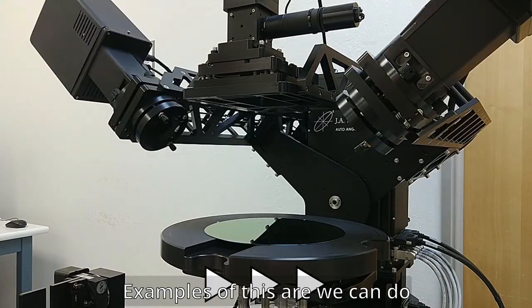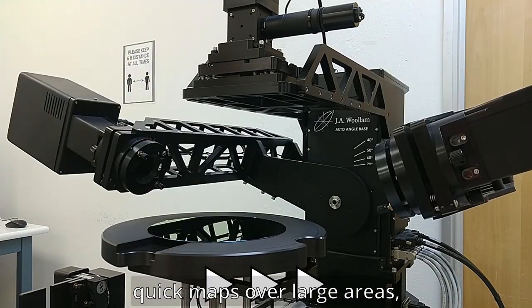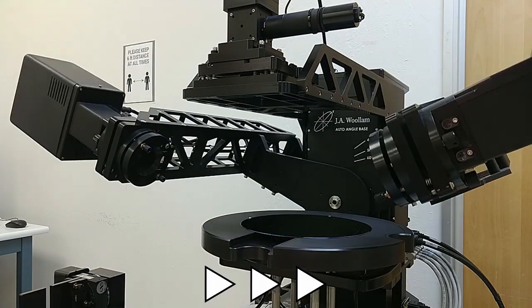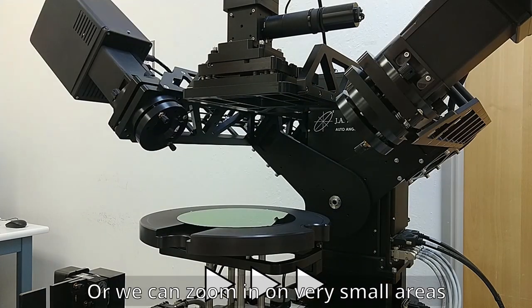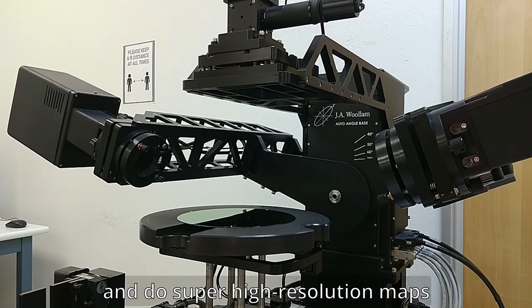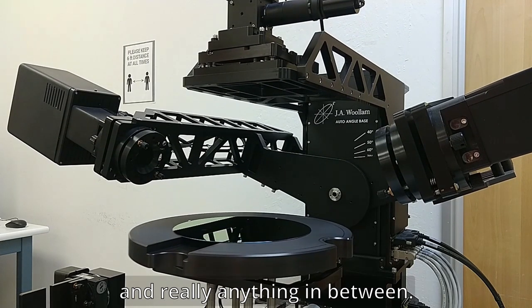For example, we can do quick maps over large areas just to try and get an idea of general uniformity, or we can zoom in on very small areas and do super high resolution maps — and really anything in between.